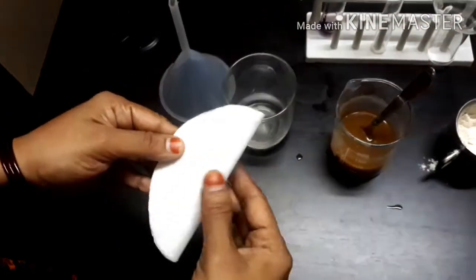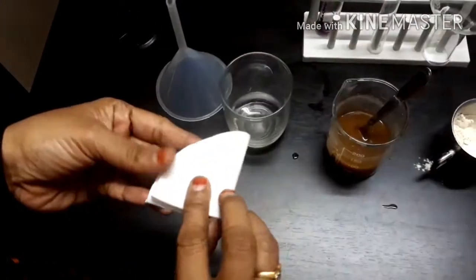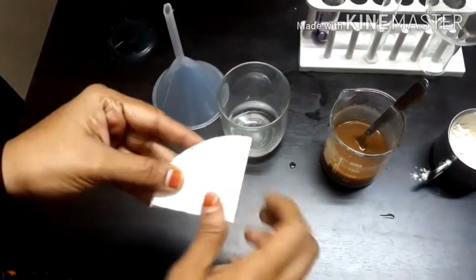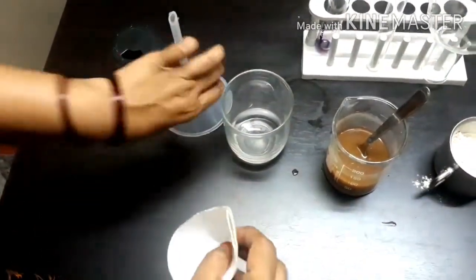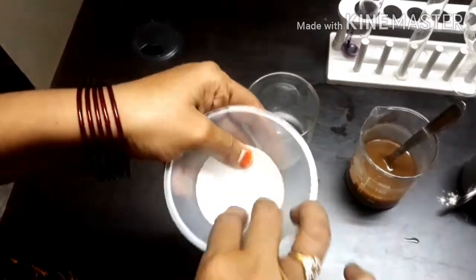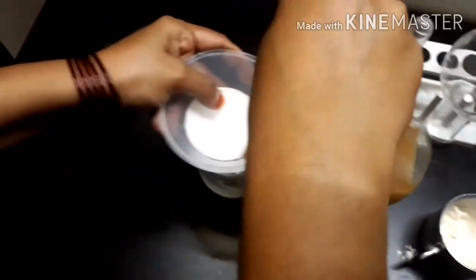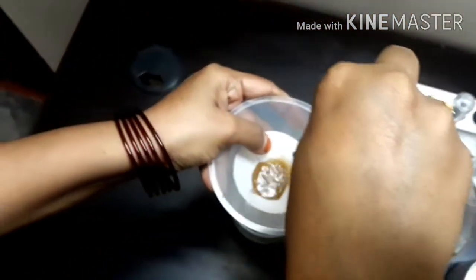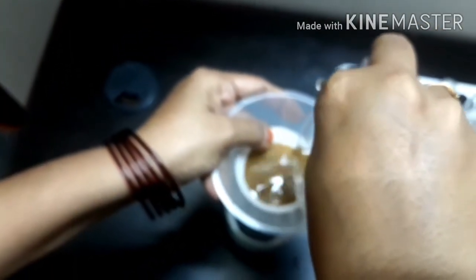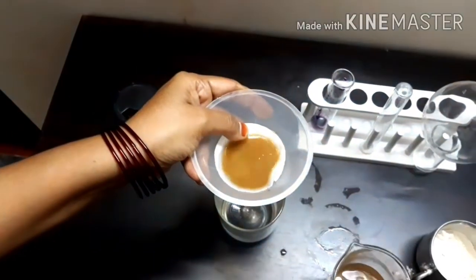Now pour the solution into the funnel through the filter paper. Then observe what remains on the filter paper, what the filter paper allowed to pass through, which substance is not allowed by the filter paper to pass through, and why certain substances are not allowed to pass through the filter paper.